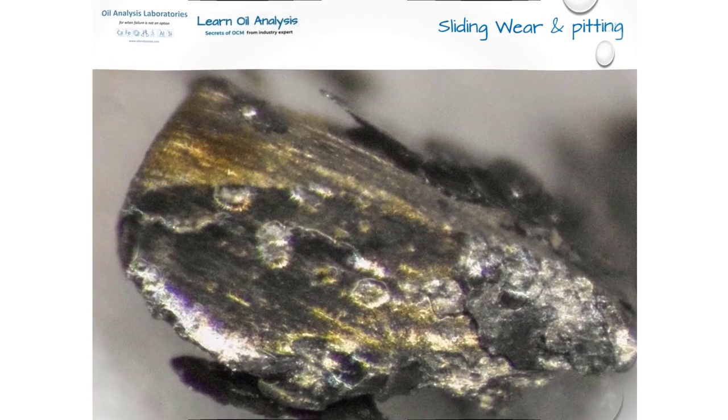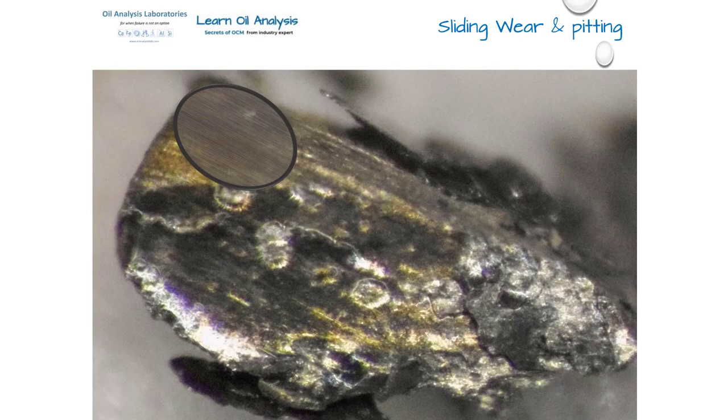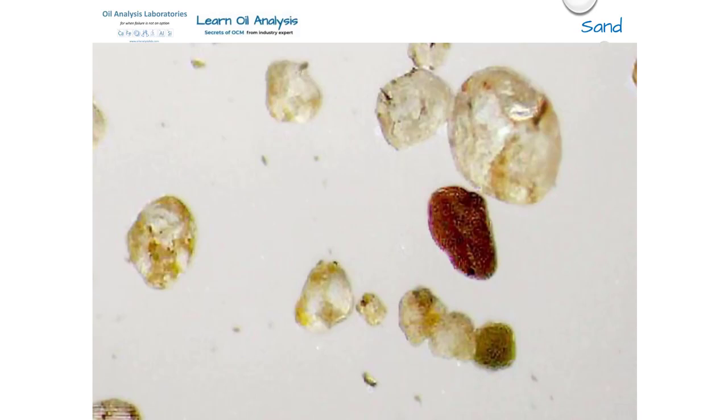On screen now you can see a particle of sliding wear, which if you look closely you can see it has almost a grain effect to the particle. These parallel lines, called striations, are caused by two surfaces sliding against one another. Let's have a look at another microscope picture now, this one being of sand particles.